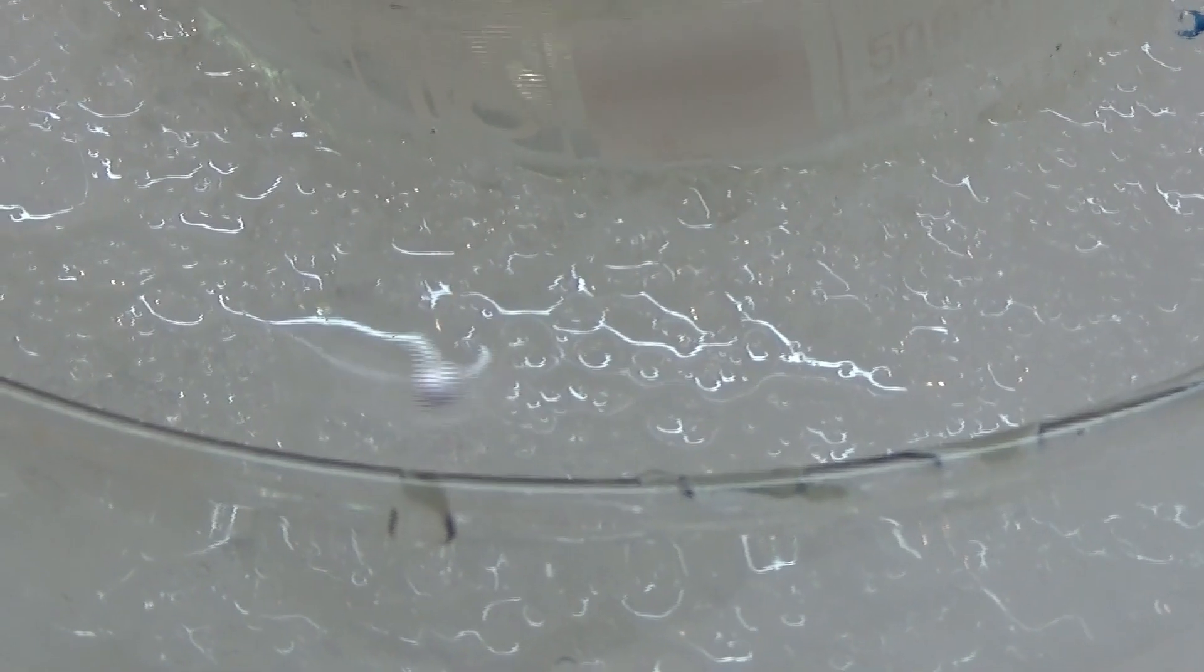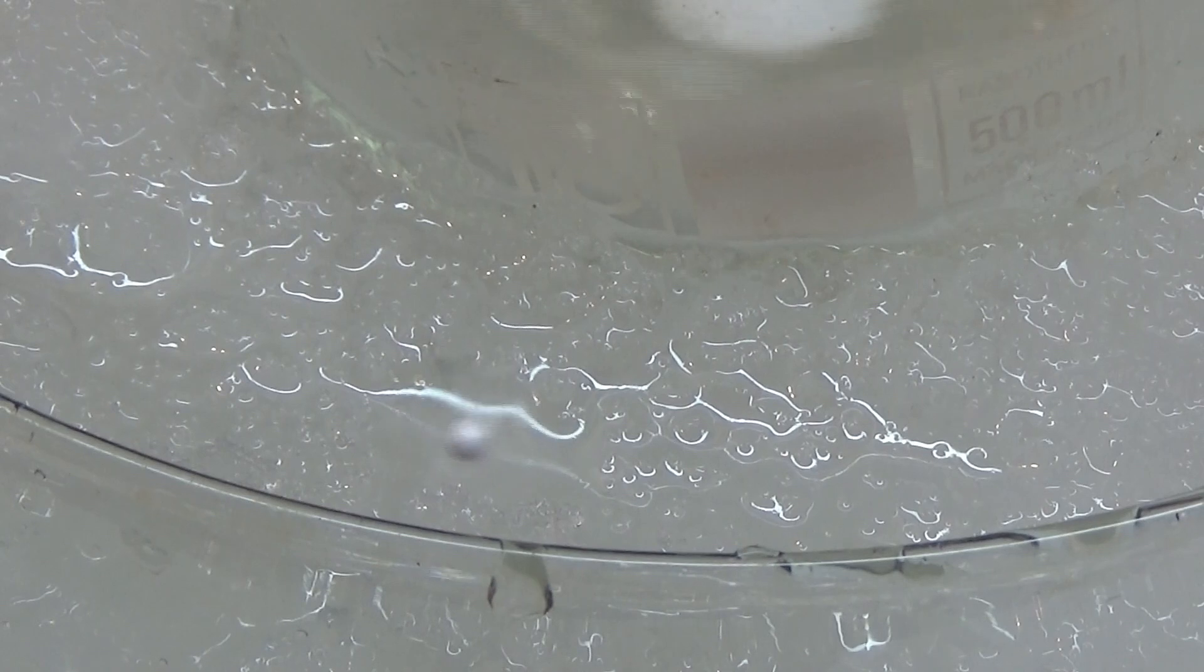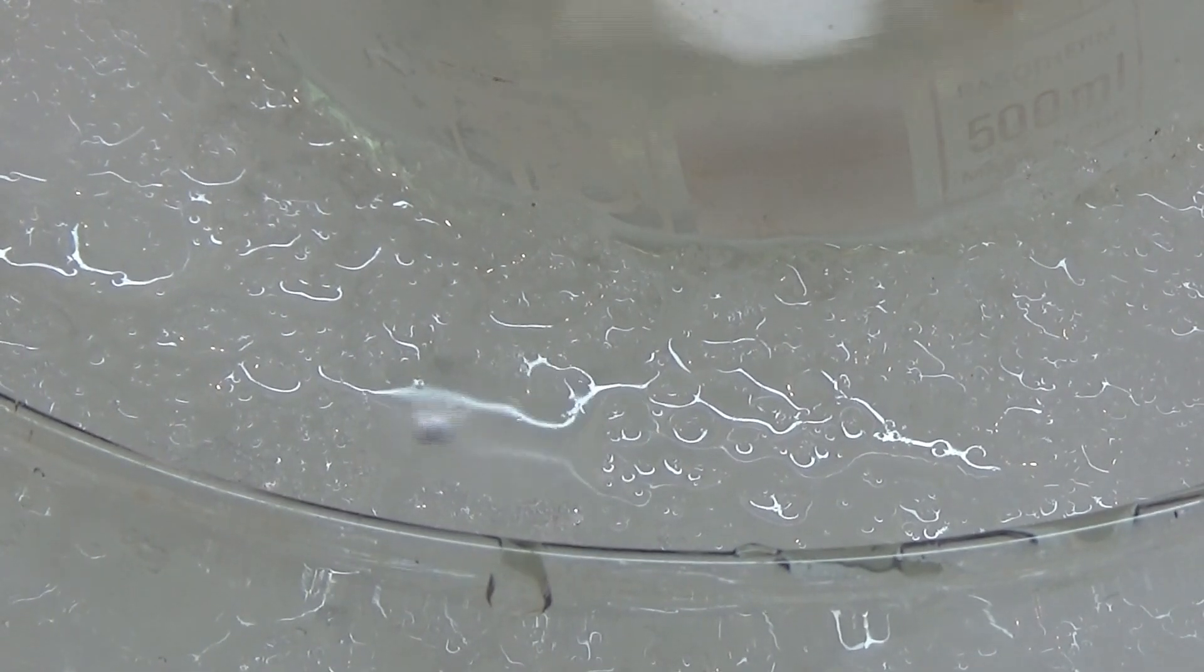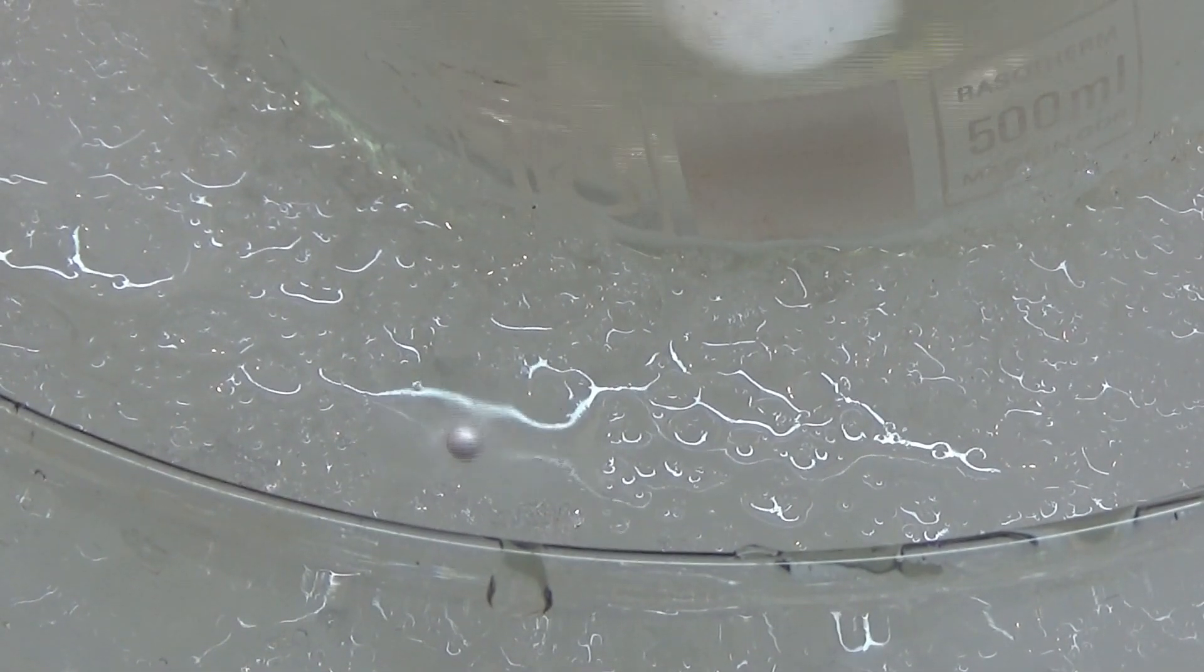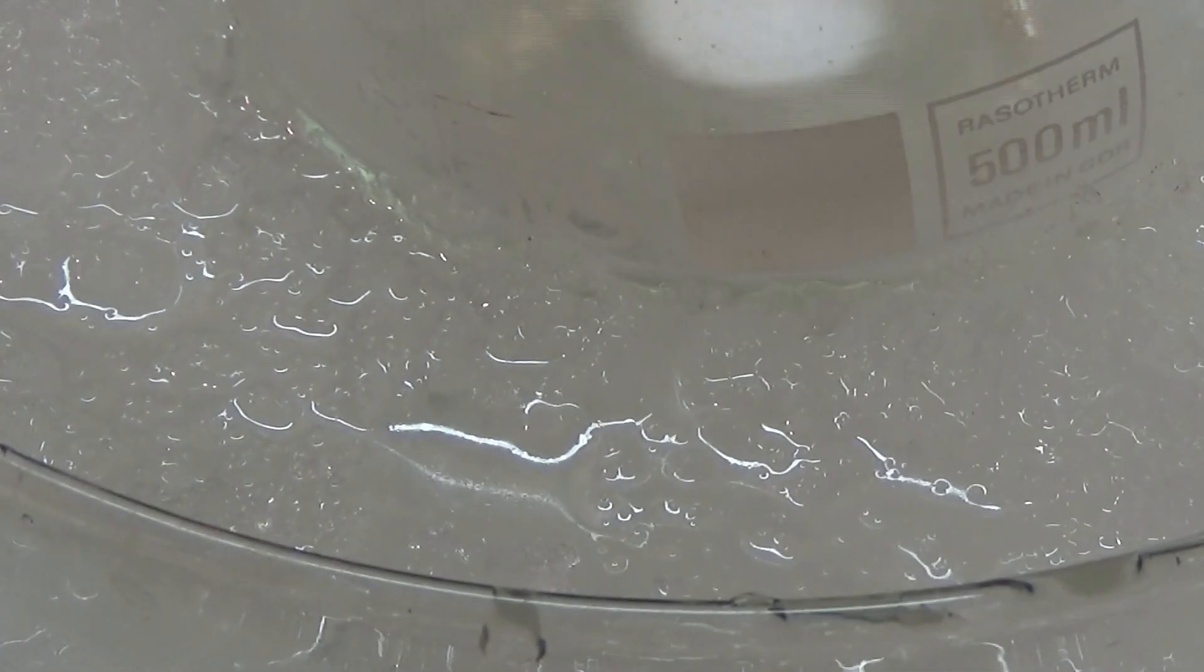The ice bath is kinda useful safety-wise if you're not covering it with aluminum foil, because if you drop the sodium it lands straight in water. And only if you are lucky like I am it does not explode your lazy ass to bits.